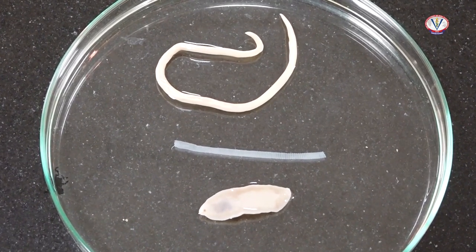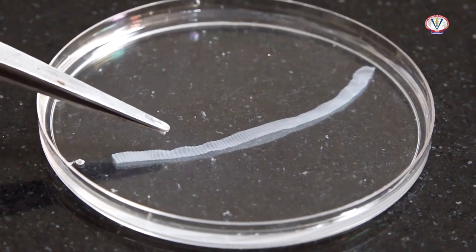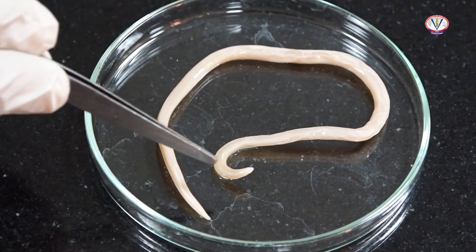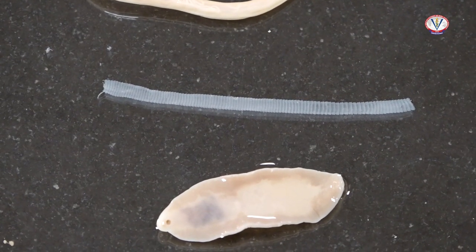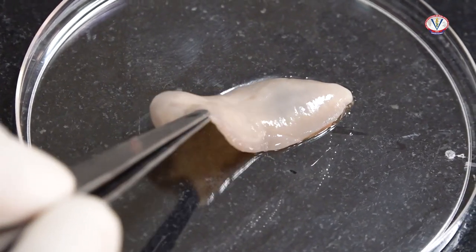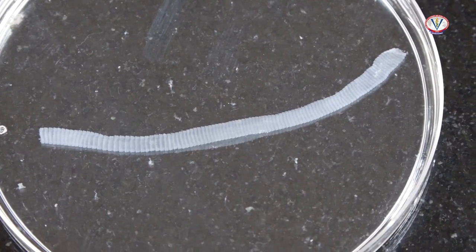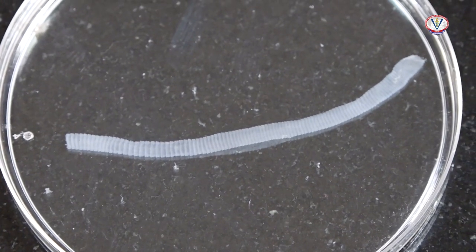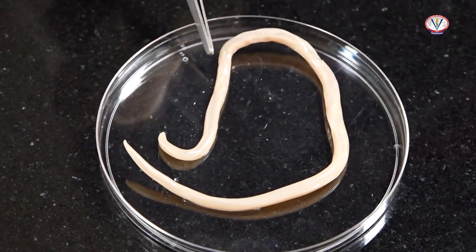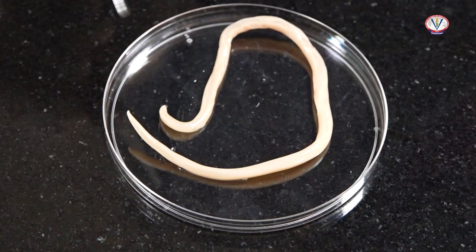Helminth parasites can be broadly categorized into three groups: the trematodes or flukes, cestodes or tapeworms, and nematodes or roundworms. These three groups can be easily differentiated macroscopically based on their morphological characteristics. Trematodes are dorso-ventrally flat, leaf-like, unsegmented worms. Cestodes are elongate, ribbon-like, flat-bodied and segmented. Nematodes are typically cylindrical with pointed, tapering ends and an unsegmented body.